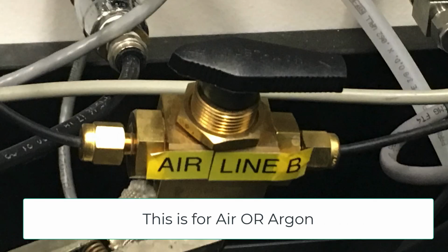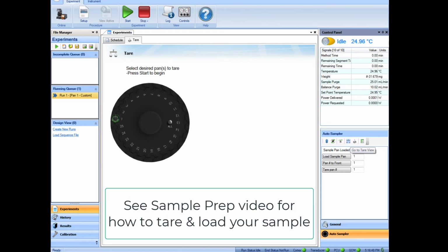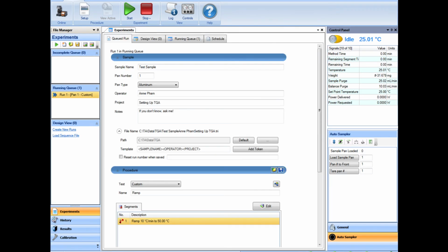So this is what the air or argon switch position should look like. The black arrow should be pointed towards the air section. If it is not at the air section, you can just twist the black knob on top and turn it towards the air position. Now is the time to tare your pans. Please review the sample prep video in order to see how to tare and load your sample. Once your samples are loaded, please make sure to check over your procedure and summary and your gas to make sure everything is correct. And once you are ready, you're now ready to start.